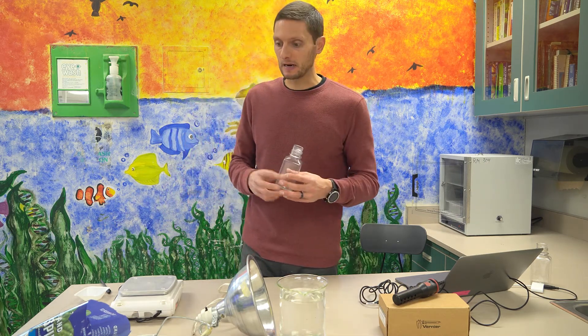So my first step to starting the lab today is I need to add some of the spinach to my biochamber. And today we're going to use six grams of spinach. So I'm going to measure that out on our scale here.